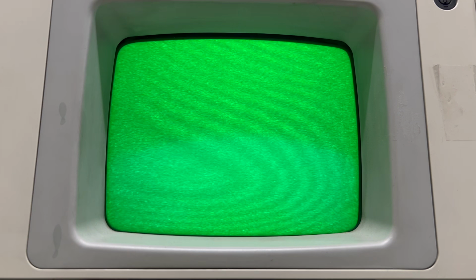Ooh, that's looking a lot better. Let's see what happens when I fiddle with the knobs this time. Okay, this is a good sign. The contrast is definitely doing something now. This is a good indication that the signal path for the detector is actually working. Brightness seems to work as well. But are we actually imaging anything, or is this just errant electrical signals?